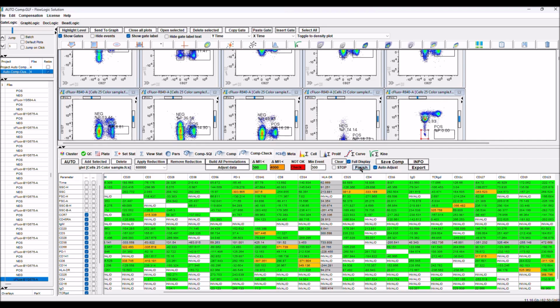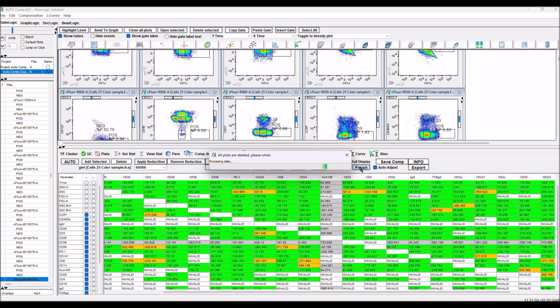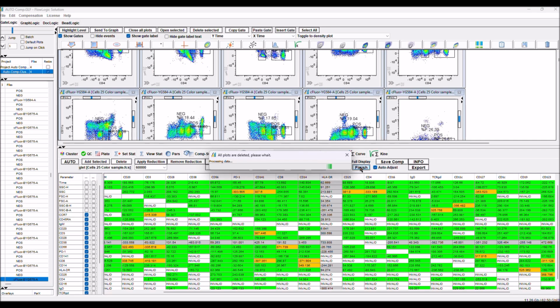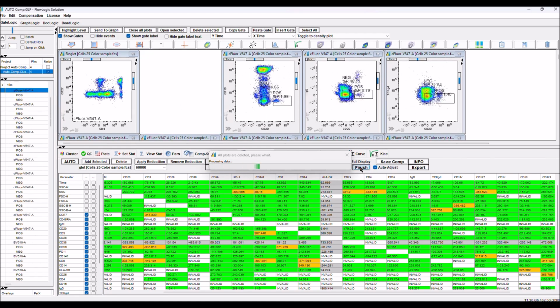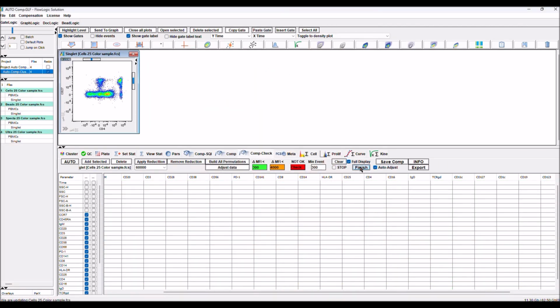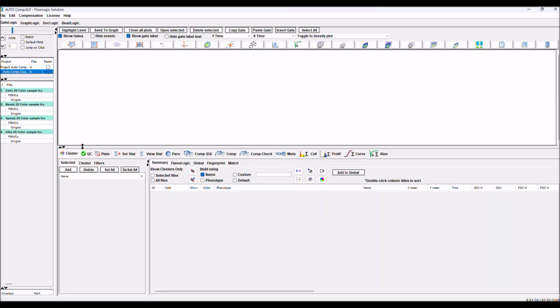So now as I finish, we clean up all the data. When we click finish, FlowLogic cleans up all the data, which is quite important. All the plots should be clean, because if we save all these plots, restarting FlowLogic will take forever. Now clean up all the plots. We remove the reduction, so we have the total number of events logged. And now that we are here, we can start clustering.